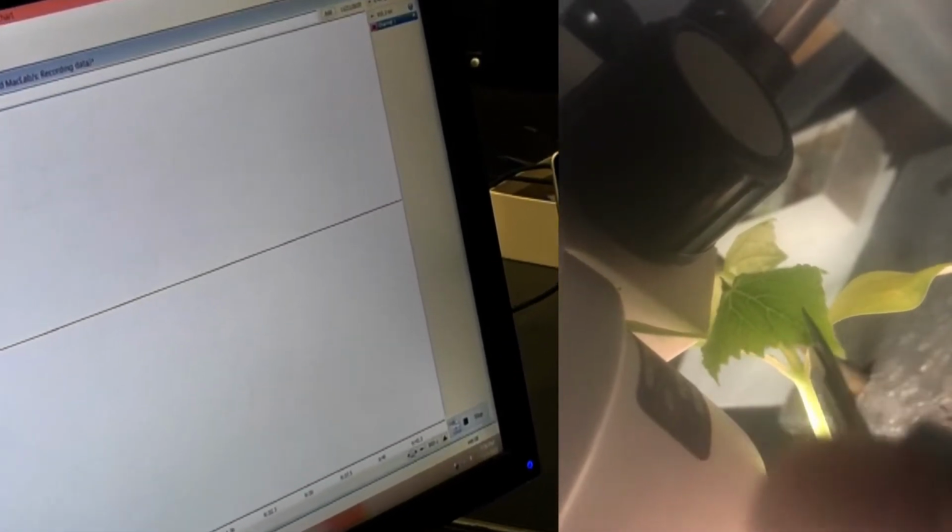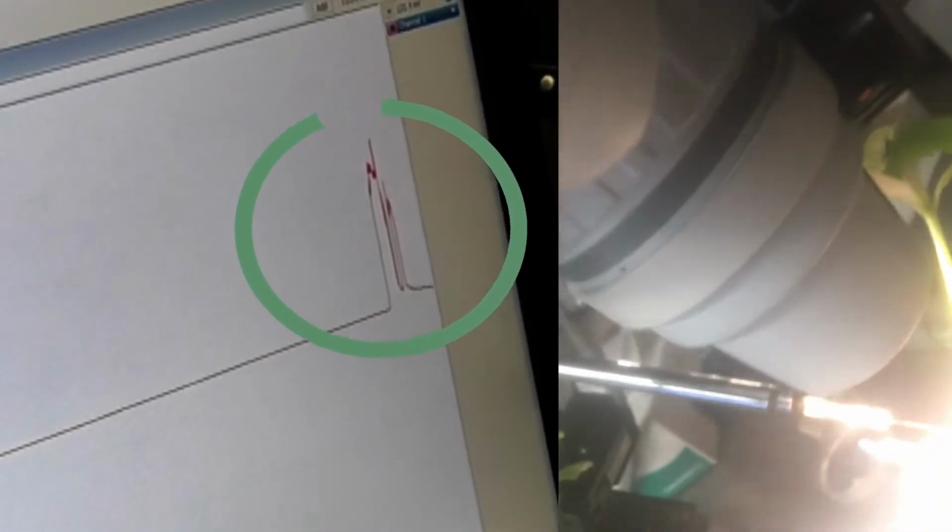So now we're going to cut a leaf, right? Yep. Okay, here we go. Let me make sure I keep it on the computer. Ready? Get set. Go. Woo! We got something. Okay.